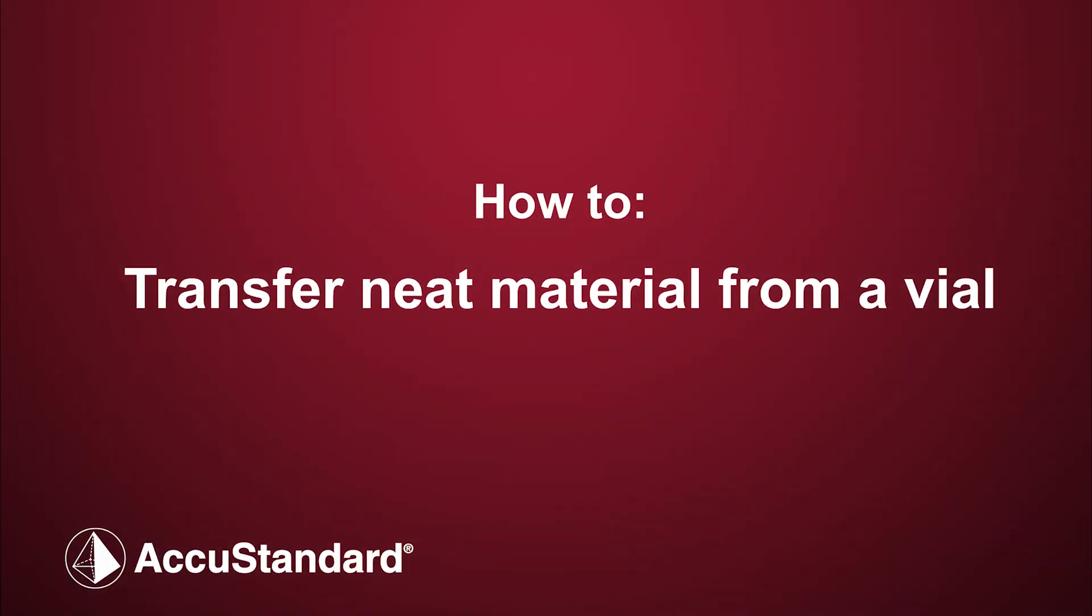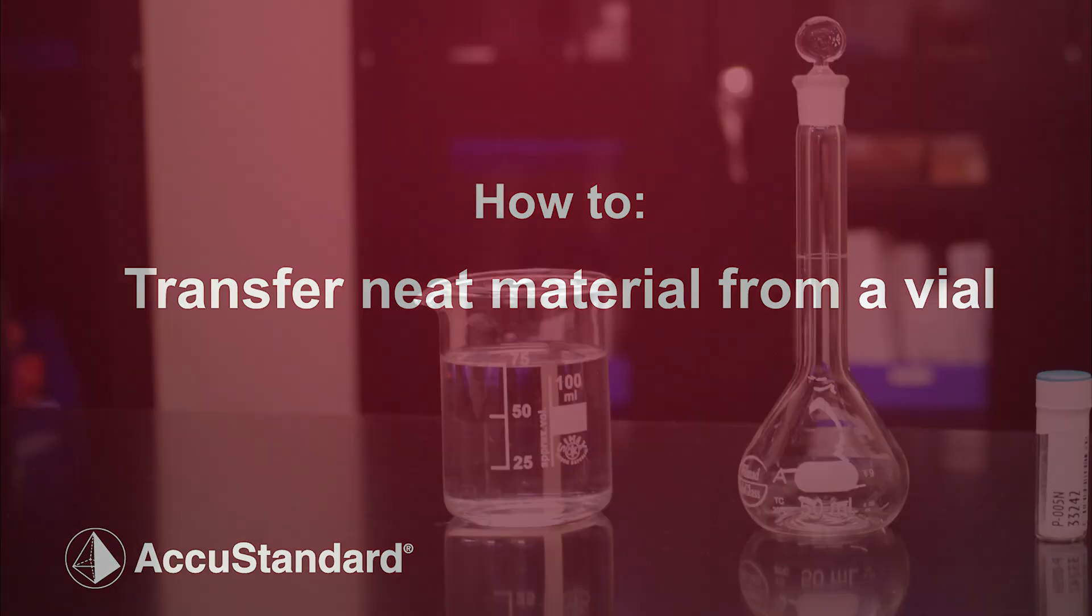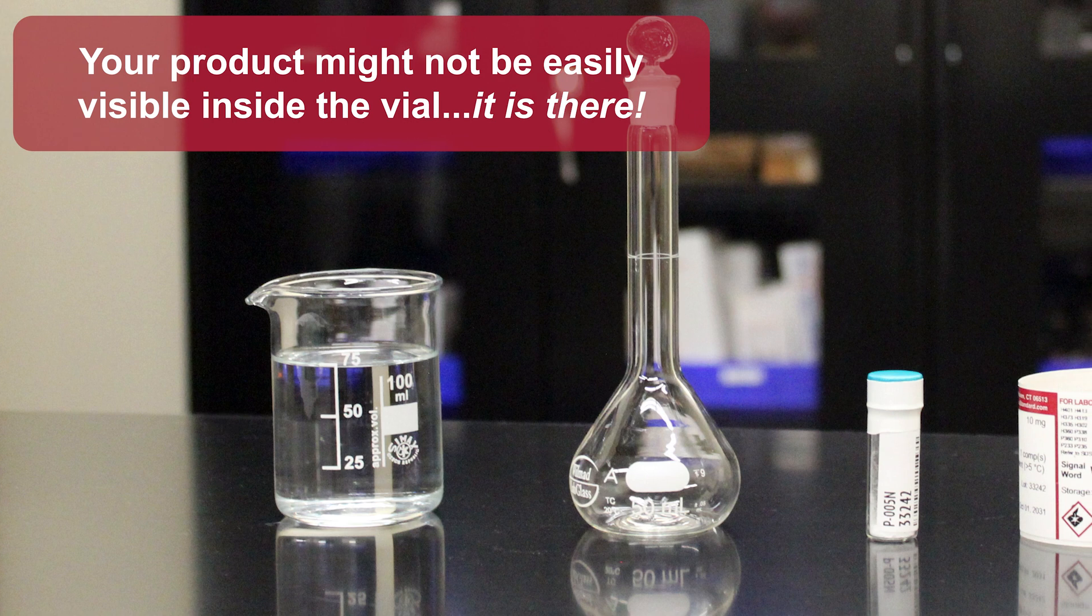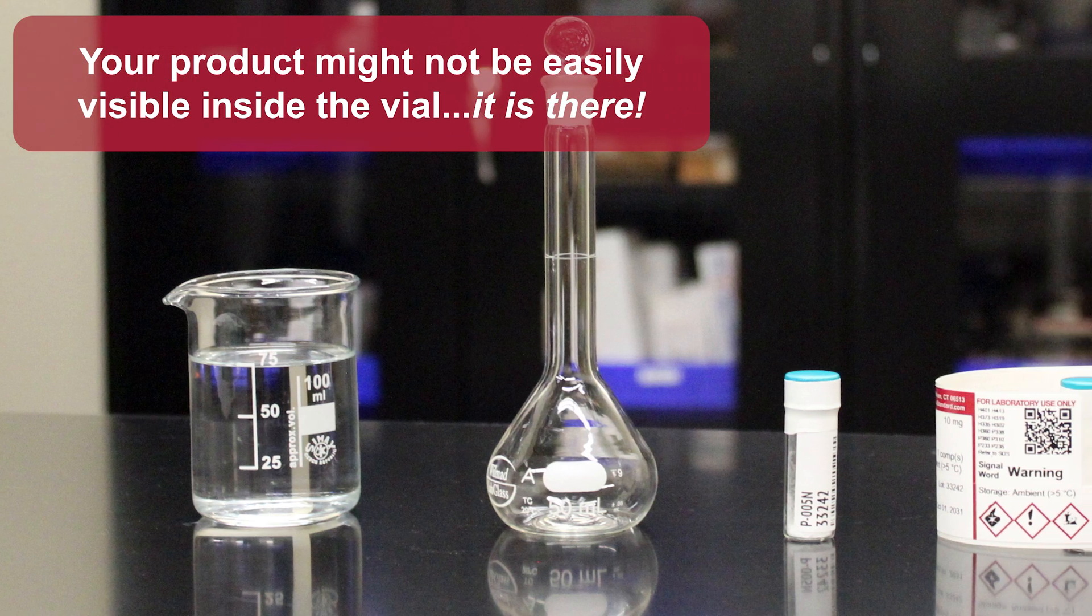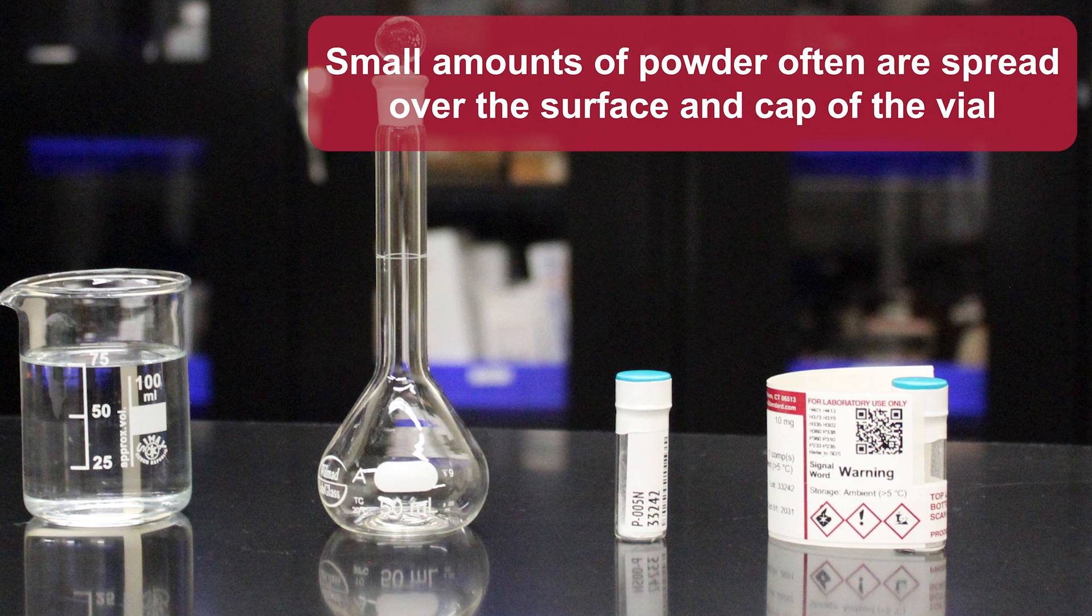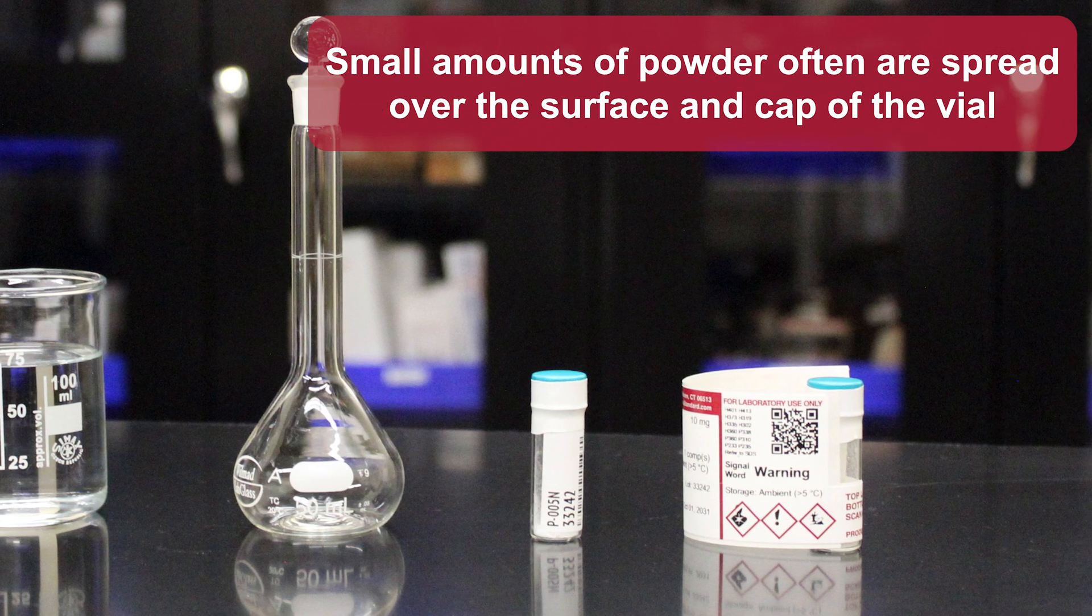How to transfer neat material from a vial. Your product might not be easily visible inside the vial, but it is there. Small amounts of powder often are spread over the surface and cap of the vial.